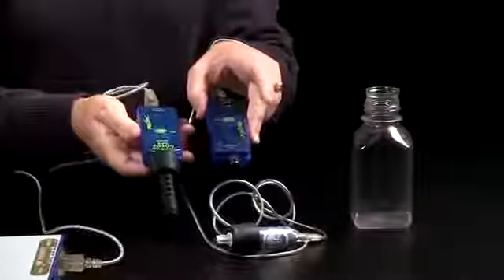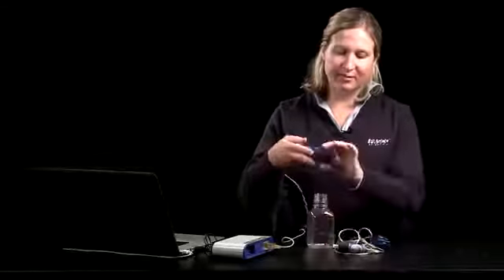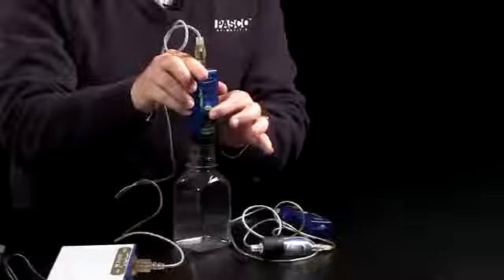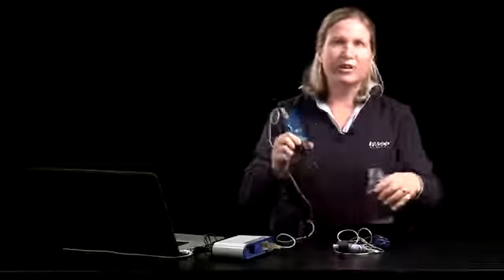The front of each of the sensors has a green calibration button, and you'll want to calibrate using an empty sampling bottle. Each of the sensors comes with the sampling bottle. You can plug the sampling bottle with the sensor, hold down the green calibration button, and when you see the flashing light behavior change, then you know that your sensor is calibrated. For each of the demonstrations that I'm going to show you today, I've already calibrated the sensors.